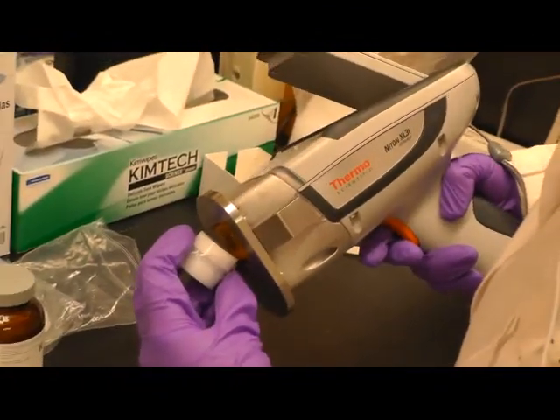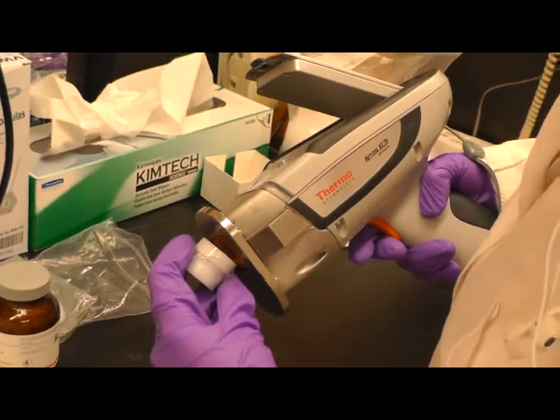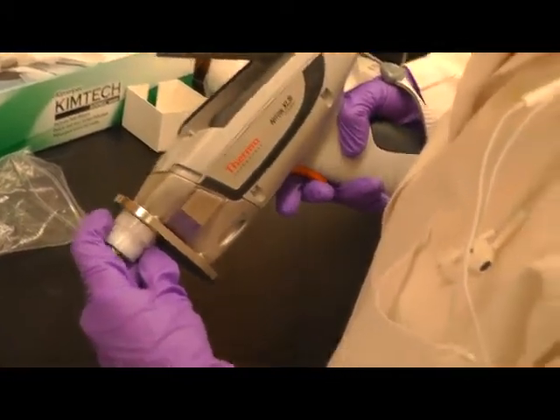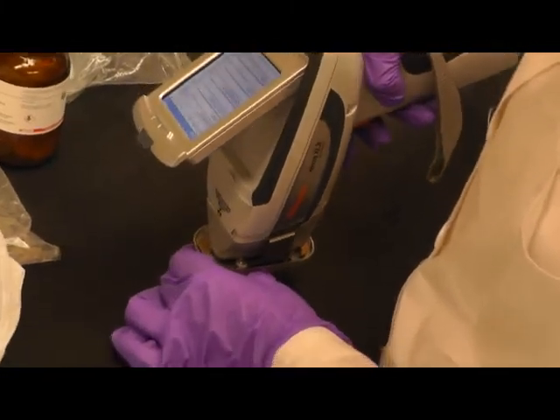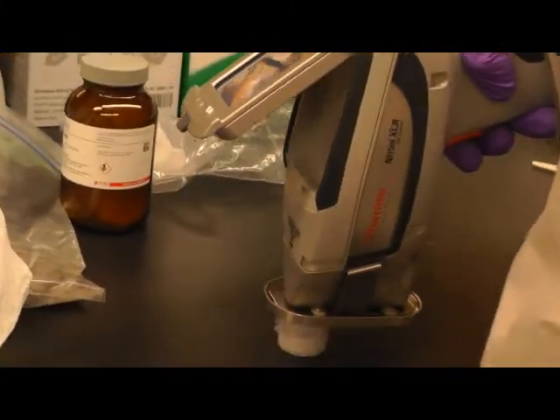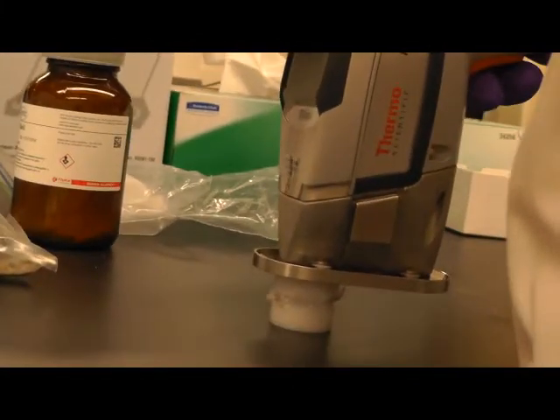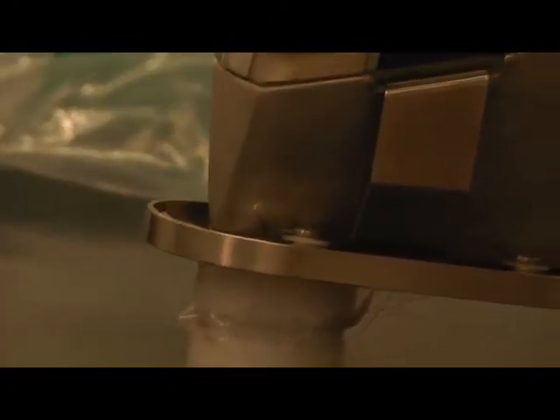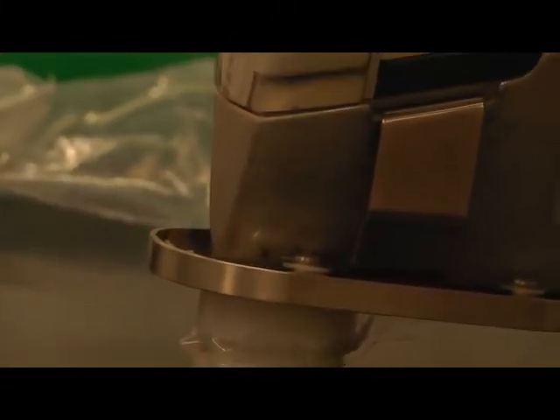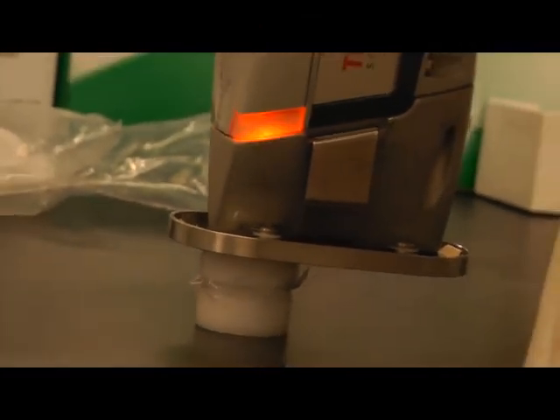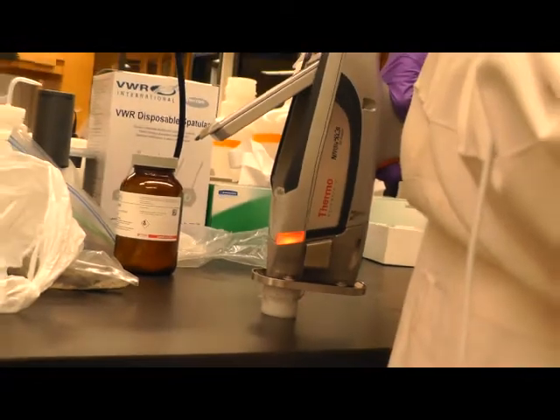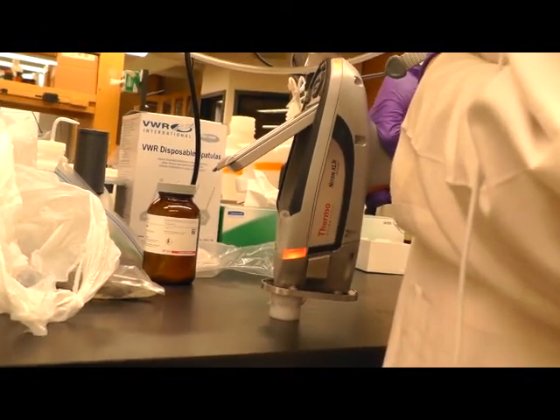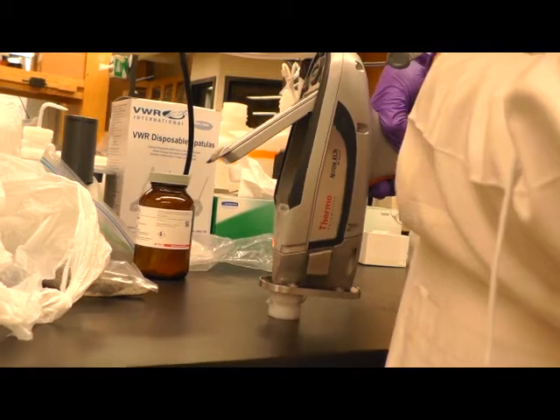And again, align the hole on the XRF instrument at the center of your sample cup. And when you are ready, press down the orange button and the measurement will start. And again, we hold the orange button for 90 seconds.